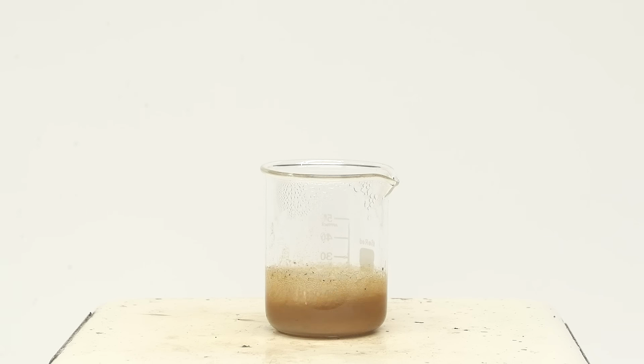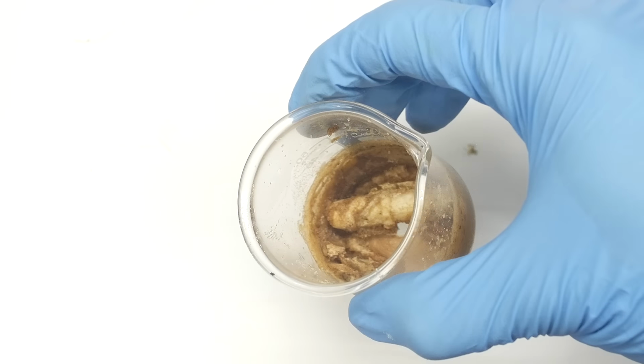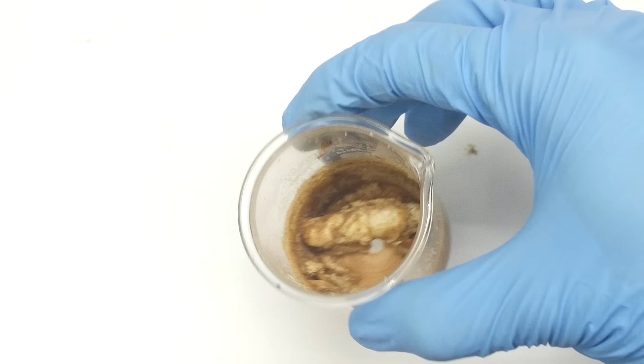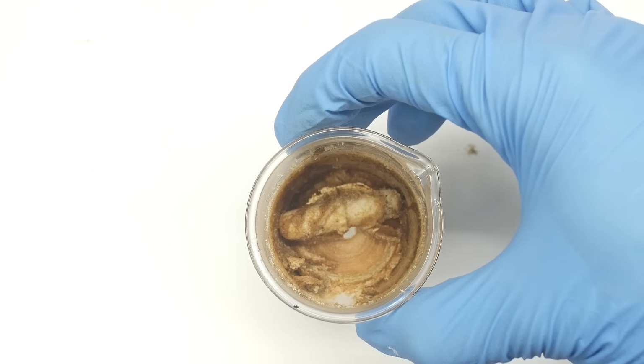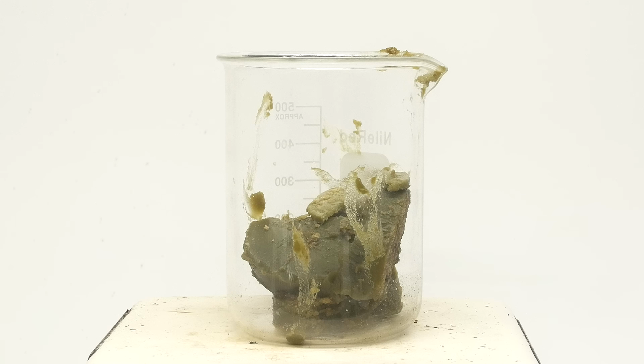When I first started this project, I was really hoping that the glycerol would just magically still be in there, even though it's not listed on the ingredients. The idea of isolating both the glycerol and the fatty acids from the soap, and then recombining them to make the oil, seemed really cool to me, but unfortunately, I'm gonna have to use store-bought glycerol. Anyway, moving on, these are the fatty acids that I've isolated.